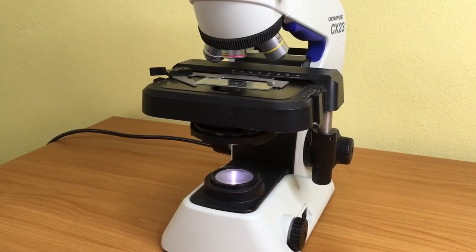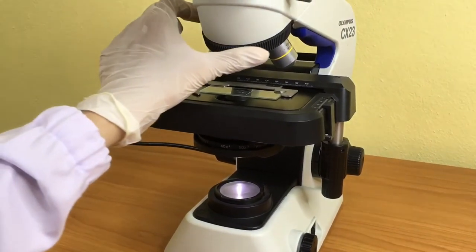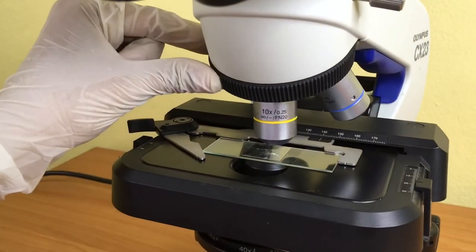To change the objective lenses among different magnifications, you must turn the nose piece.